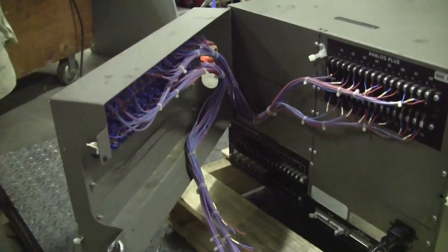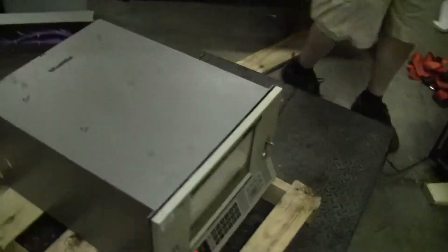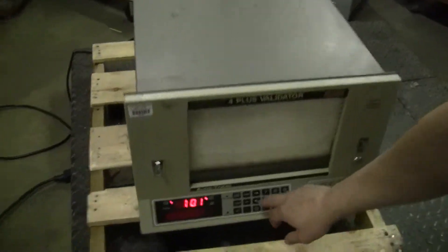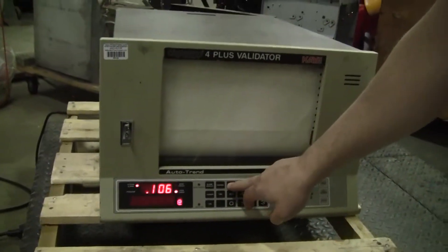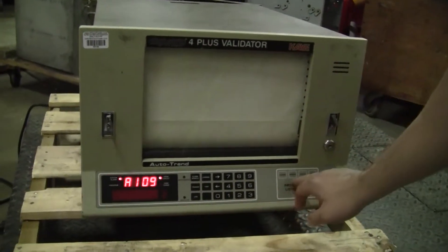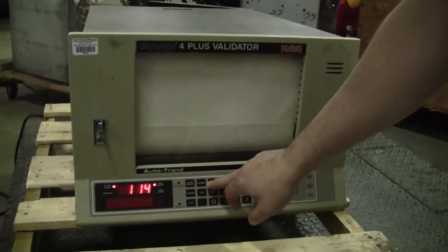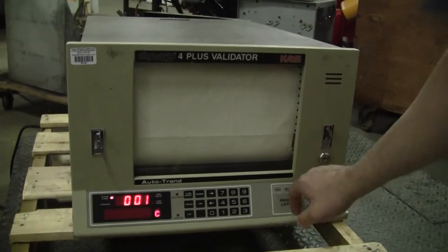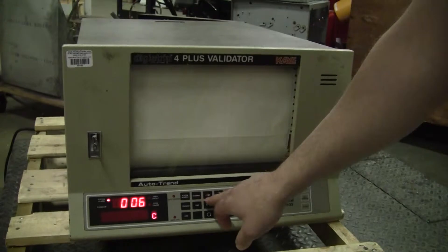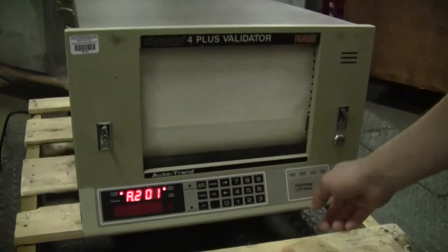Let's go back to the front. You can play with the channels. Configurations, messages. Channels. Keyboard seems to be working right.